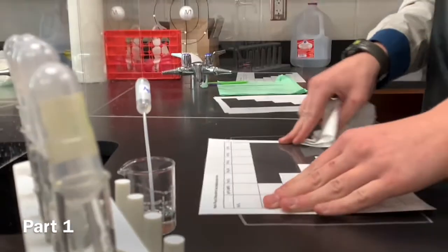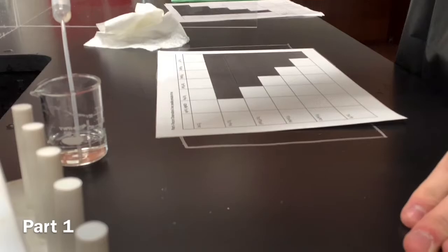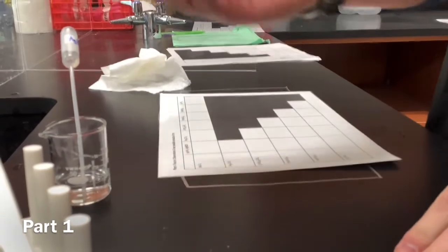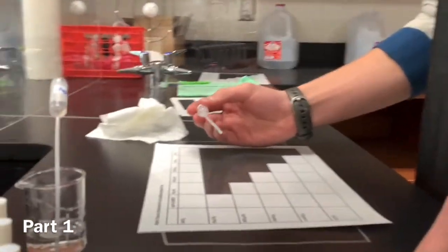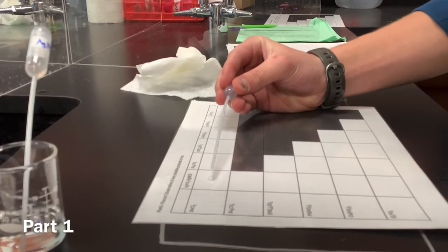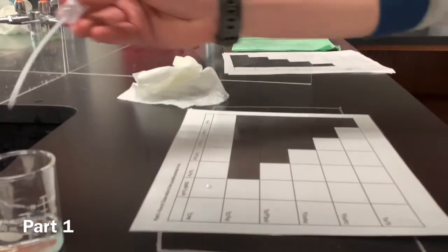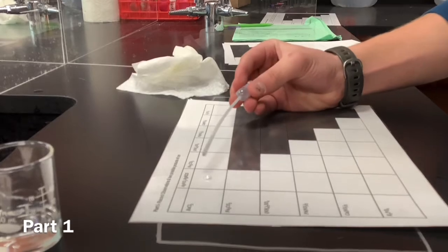All right. Let's see. Okay, so first we're gonna do BaCl2. This one right here. I want to pop it, but I don't know if that's... Oh, there it goes. Okay. And then we'll get the product. Nice dropping, Taylor. And then you do your AgNO3. This is some expensive stuff right here.